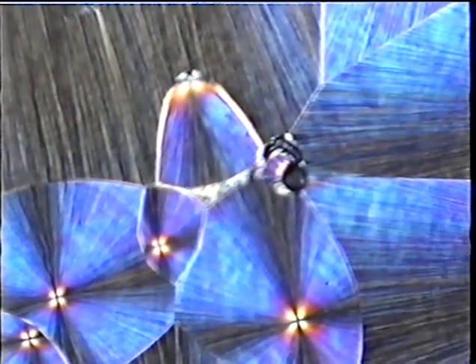If we look around a little bit, we'll see different thicknesses of the preparation, and the spherulites will change color. That's a nice set of colors there. And we have to rotate the stage whenever we see things like this. Pinwheel effect. This is DDT.